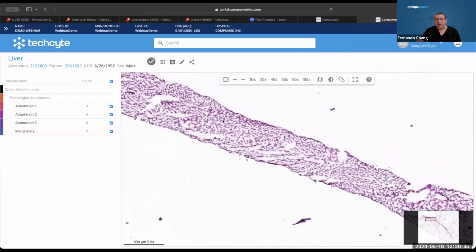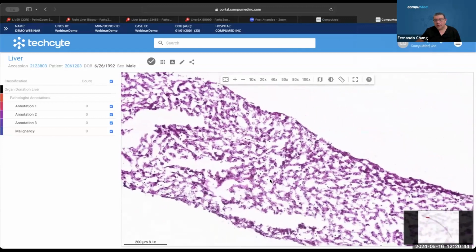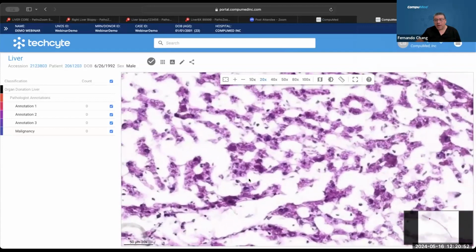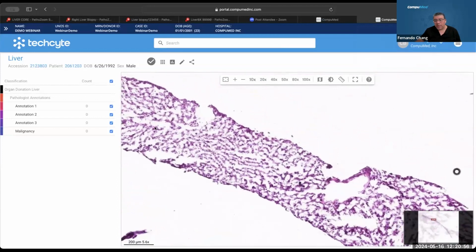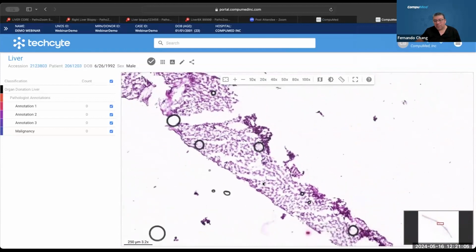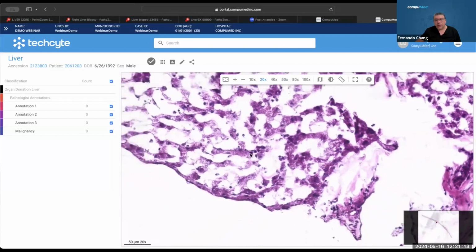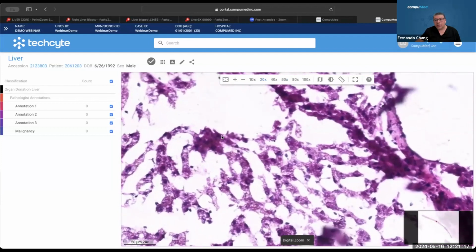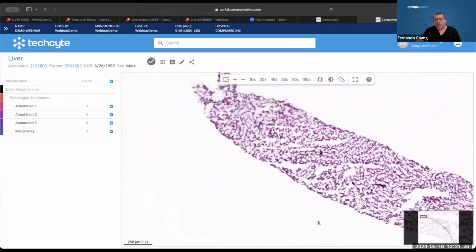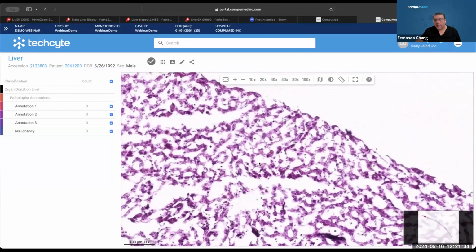And we have another liver biopsy with a lot of compression artifact. See, it forms like cords all over. This makes it obviously completely useless, unreadable. The issue in this case is the freezing artifact. We can see some bubbles around, but it's not really preventing reading. But the crushing is very notorious. Let's see, we can see some vacuolization. I'm not seeing this one much, but the architecture is completely changed in this core liver biopsy as well. Navigate to the other end of the core. And it's just compression all over the place and bubble effect as well.